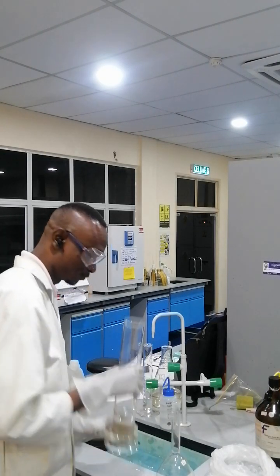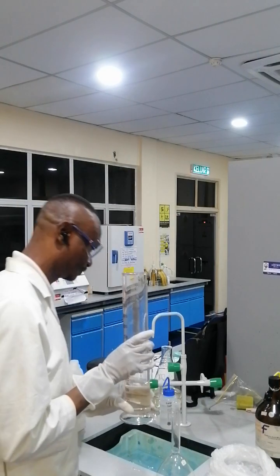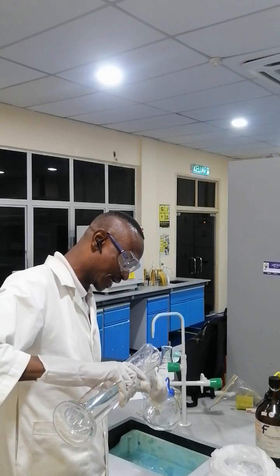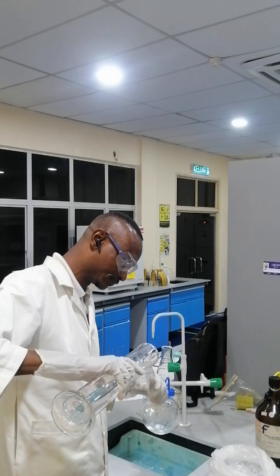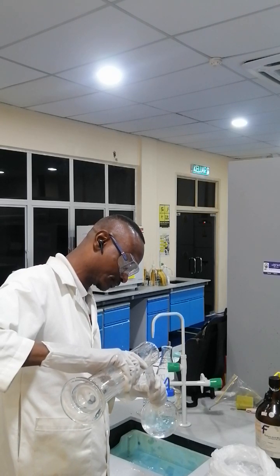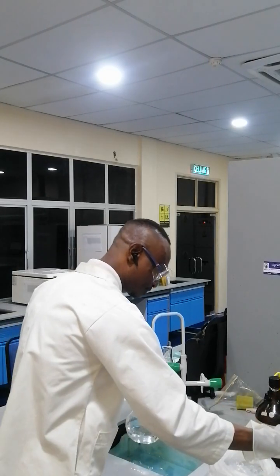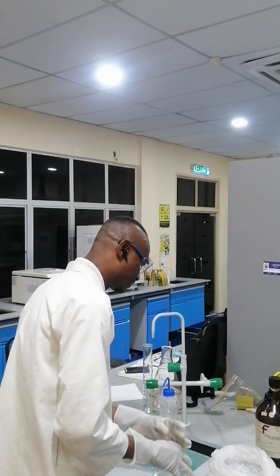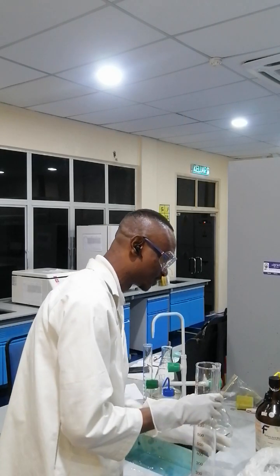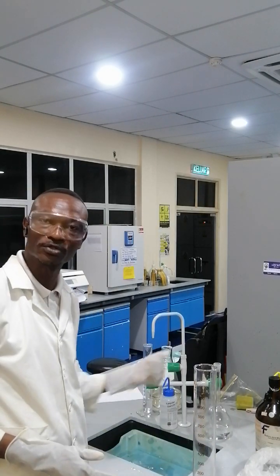The 250 ml of deionized water first of all goes into the standard volumetric flask. Then, after that, we measure 735 ml of our stock solution.